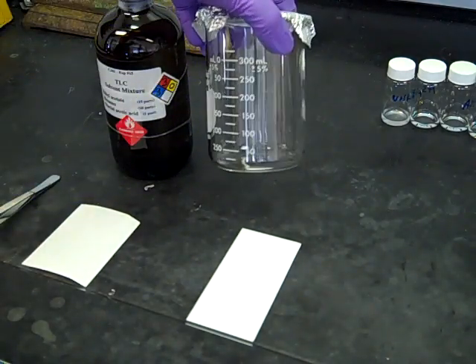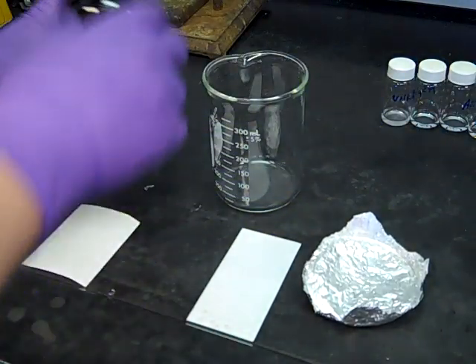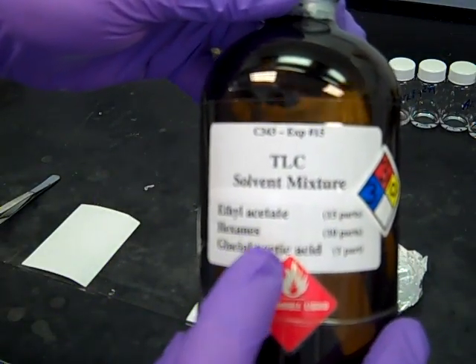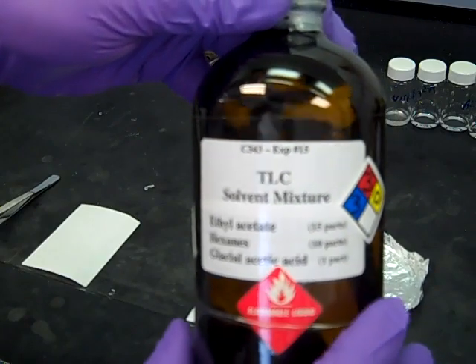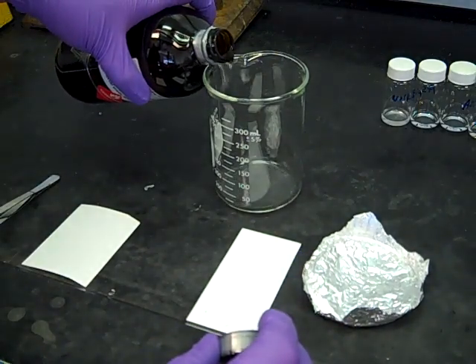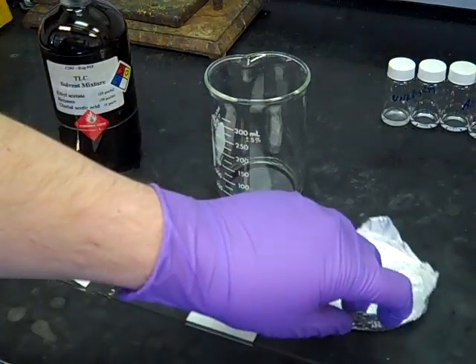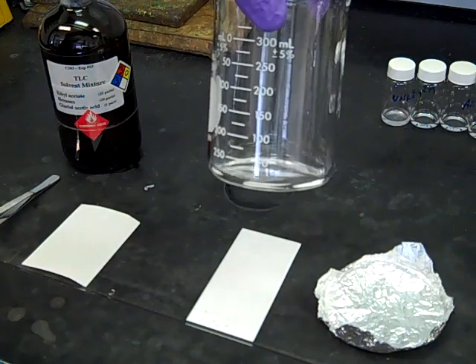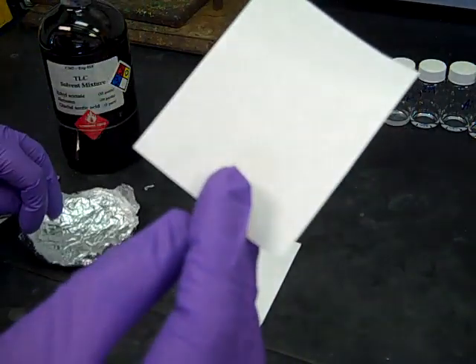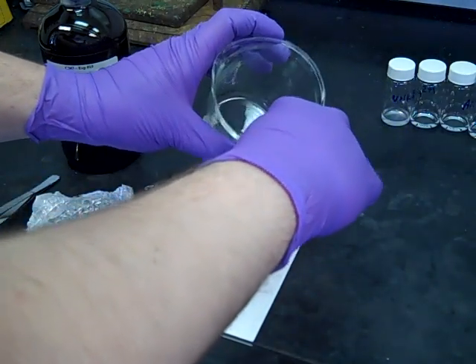Now we're going to take our beaker and fill it with the developing solvent. I'll remove the foil cap. The TLC solvent we're using has a label showing 15 parts ethyl acetate, 10 parts hexanes, and 1 part glacial acetic acid. We only need enough to just cover the bottom of the beaker—we don't need to fill it up.